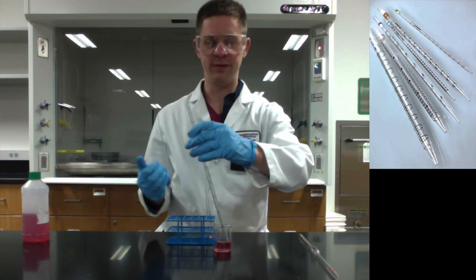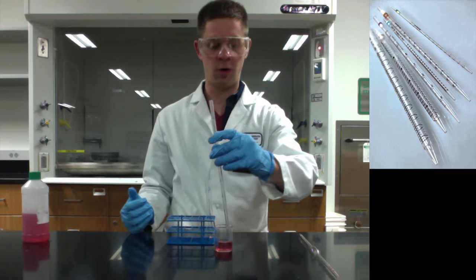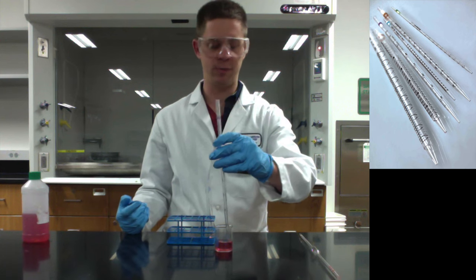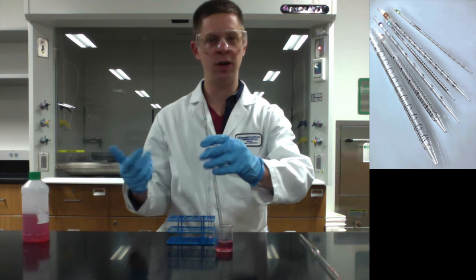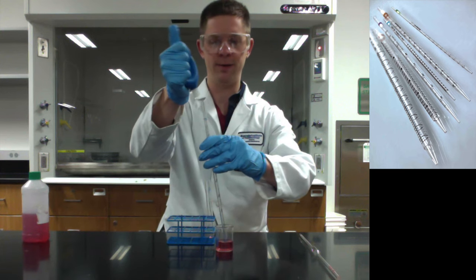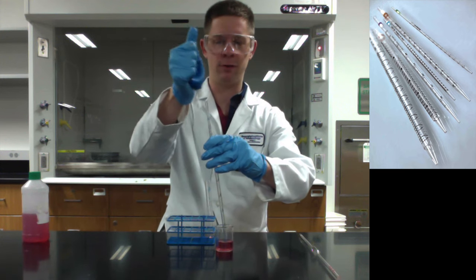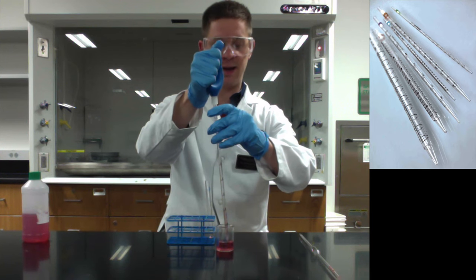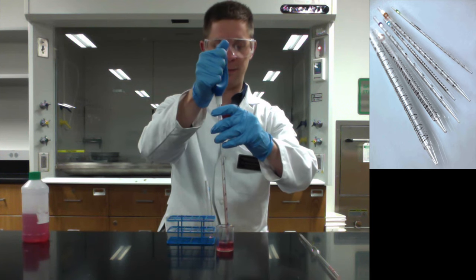Basic technique is the same as before. Pipette goes all the way in. Keep the tip of the pipette in the liquid the entire time. Just keep it down at the bottom, leaving enough room that it can actually pull liquid up that it's not forming a seal with the glass in the bottom of the beaker. Squeeze the pipette bulb first. Plastic part goes onto the end and begin letting up to pull the liquid up into this thing.